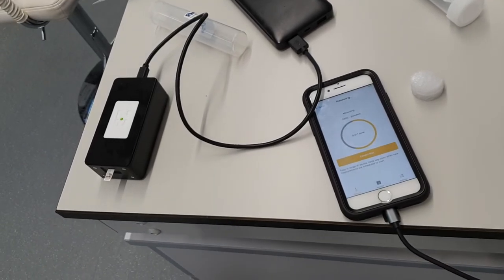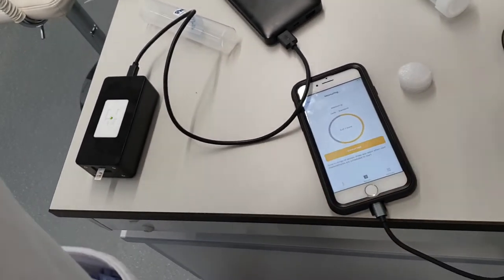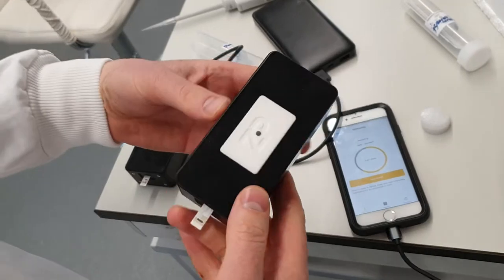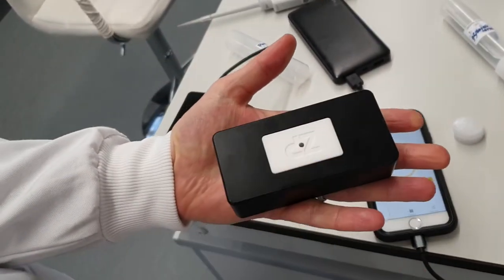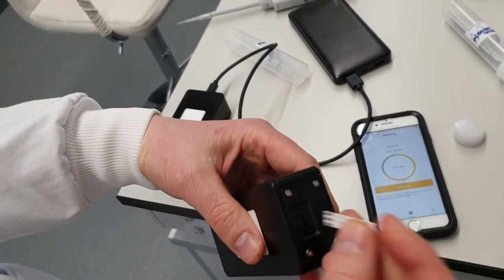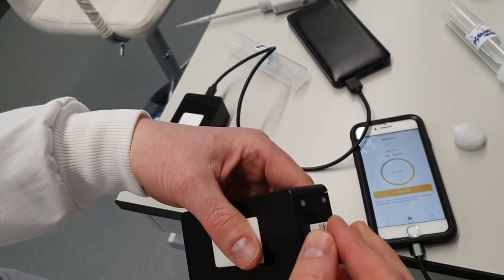If you're interested, I'm just going to show you that. So basically these little FoodSense meters, they're able to fit in the palm of the hand. It's quite easy to actually put the sensors in like that.